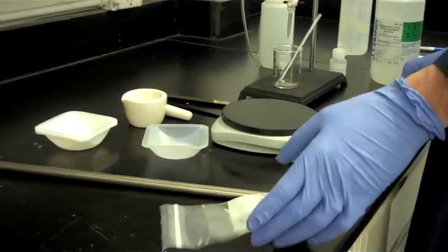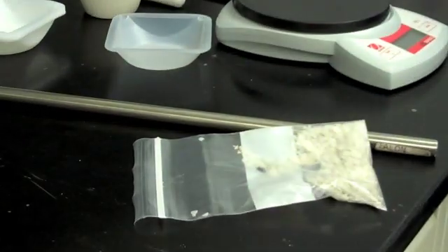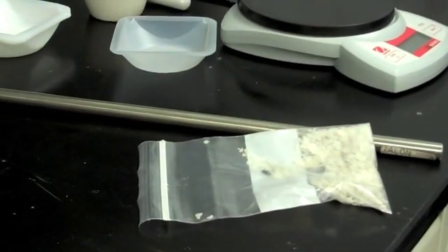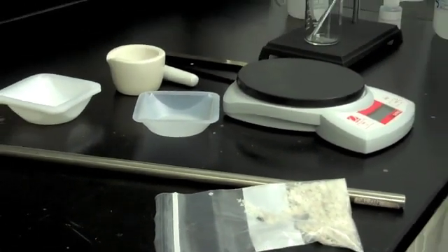The minimum amount of sample needed for one test is 6 grams. I would advise to collect more than 6 grams in case the test is not performed correctly for the first time or needs to be run more than once to verify test results.